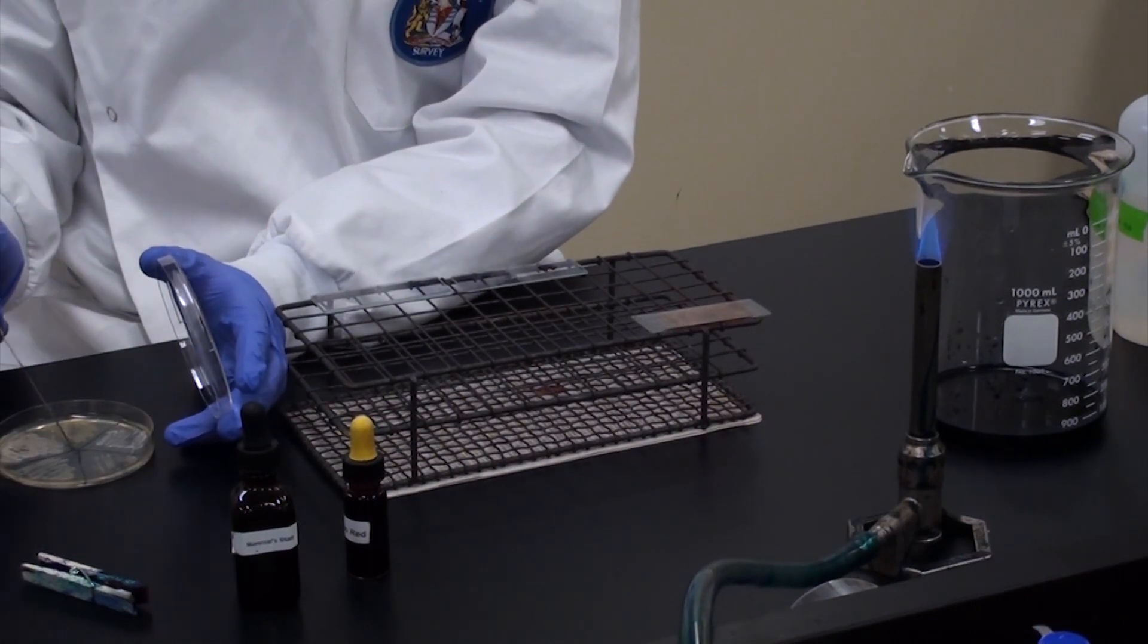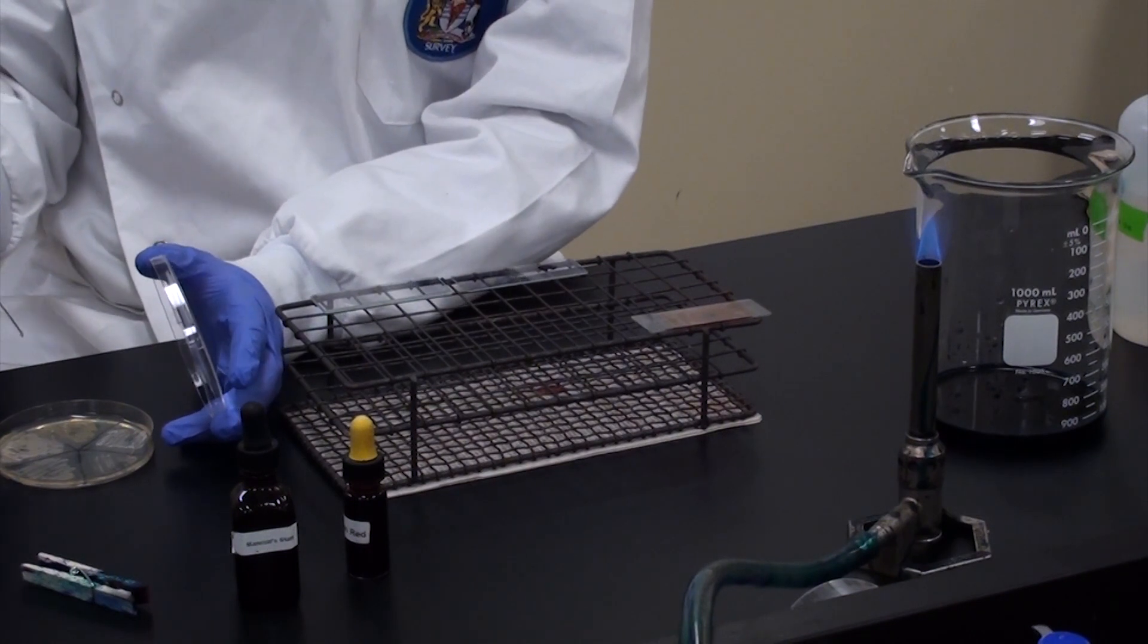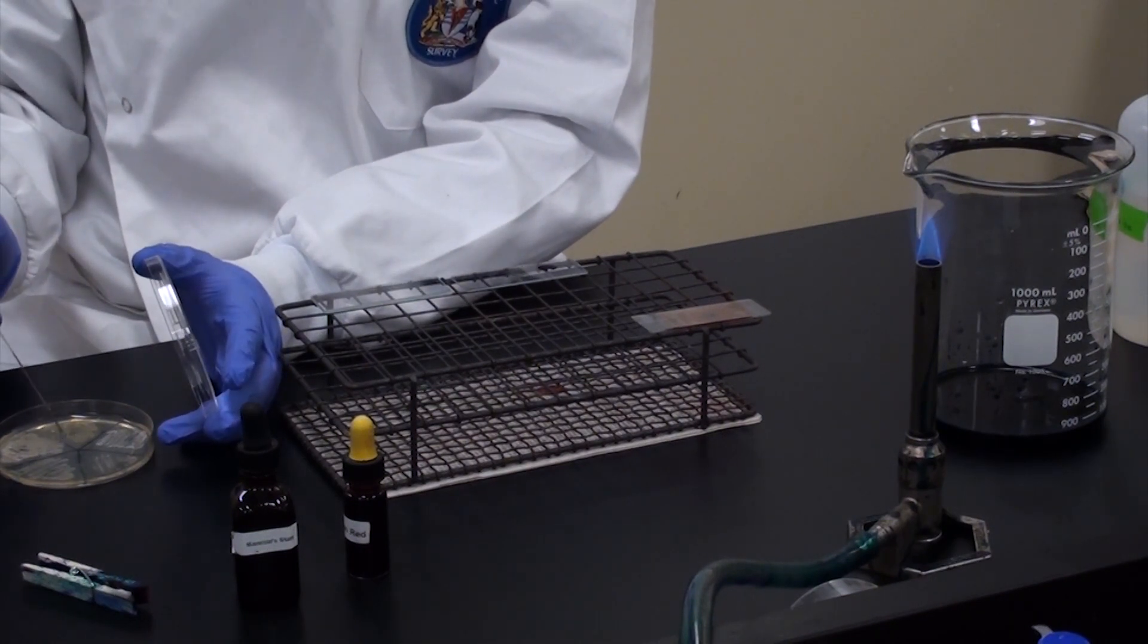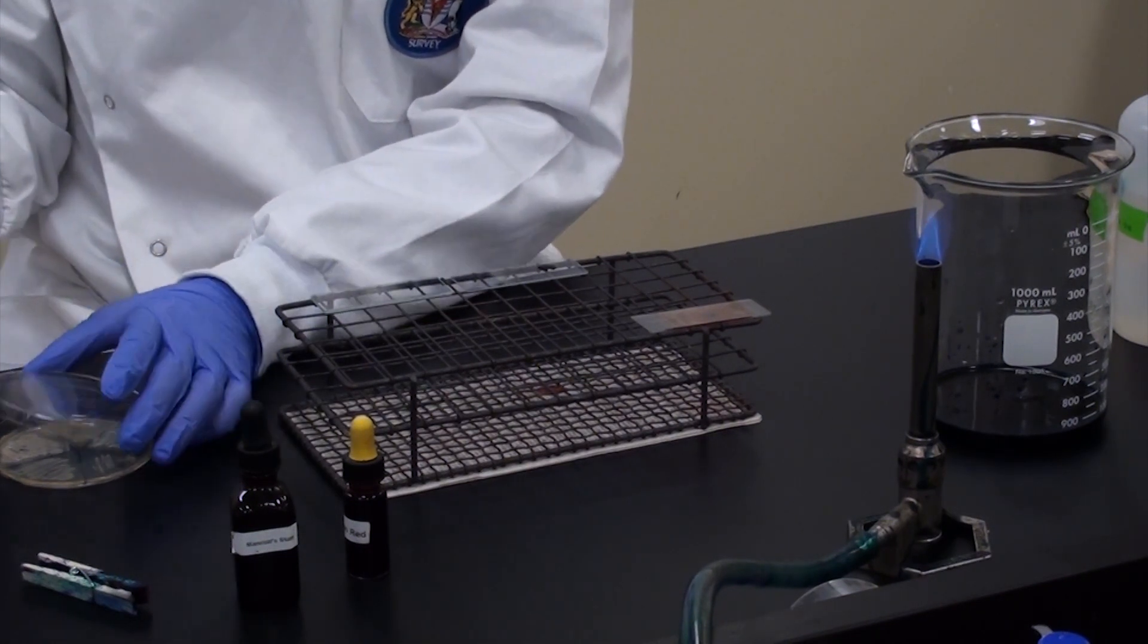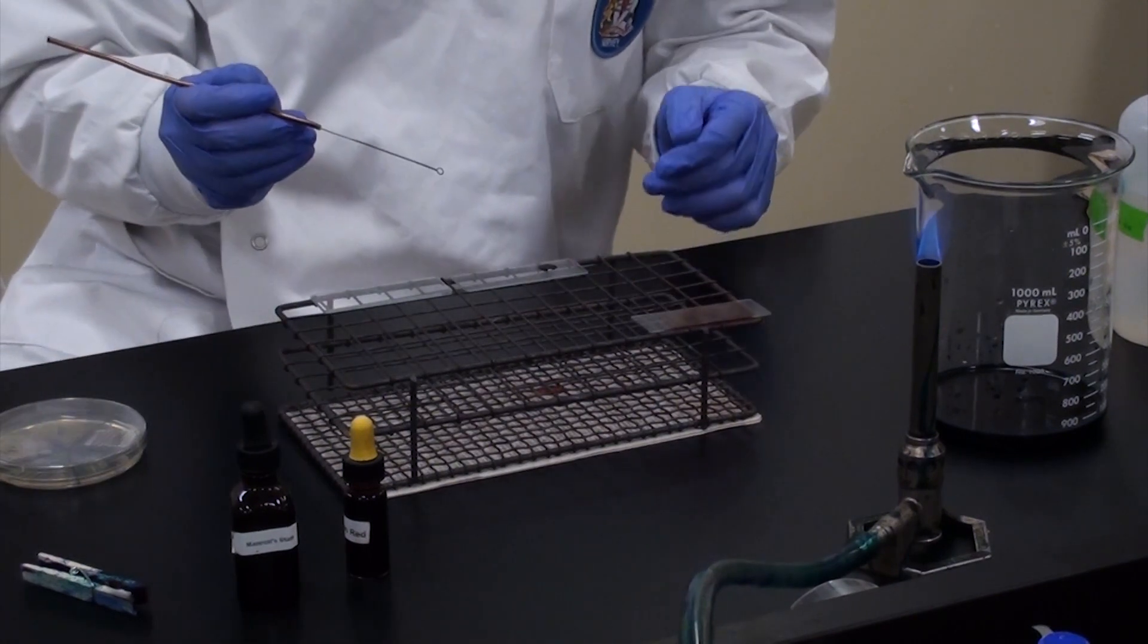Again, if it hisses, it's not quite ready. In my case, it is ready. So I'll go ahead and take a sample of Klebsiella pneumoniae. It's a little bit gooey and has a capsule, so it should be really pretty.